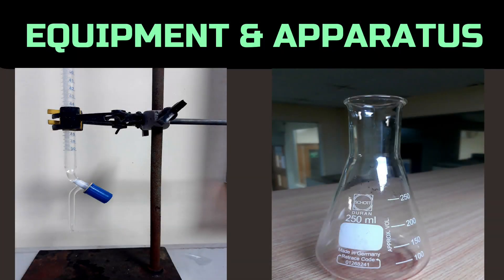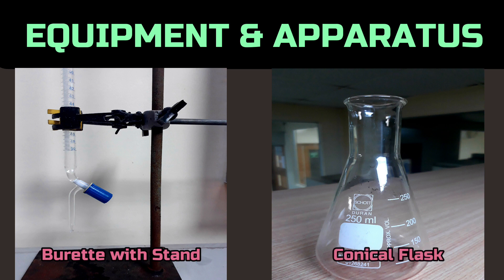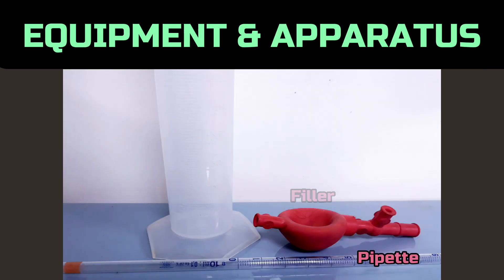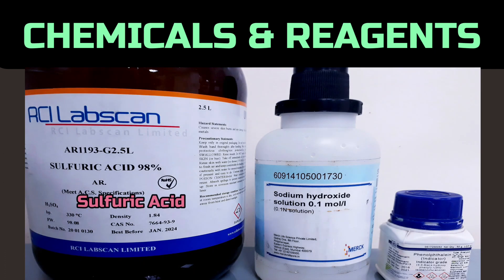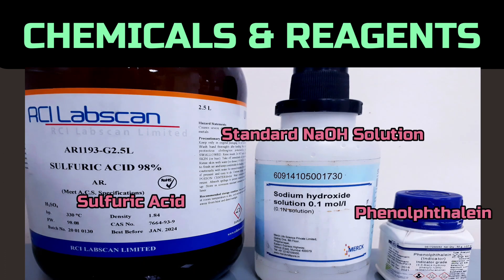Among the apparatus and chemicals, we need a burette with stand, conical flask, pipette with filler, measuring cylinder, concentrated sulfuric acid, standard sodium hydroxide solution, and phenolphthalein indicator.